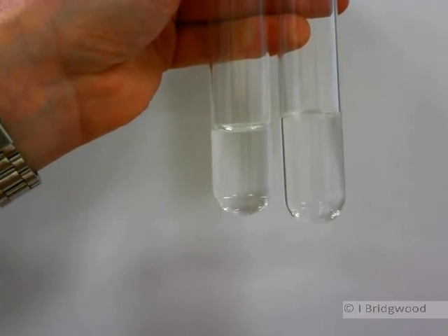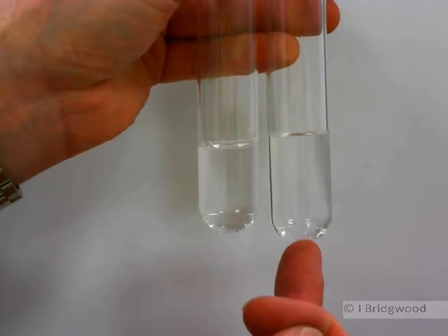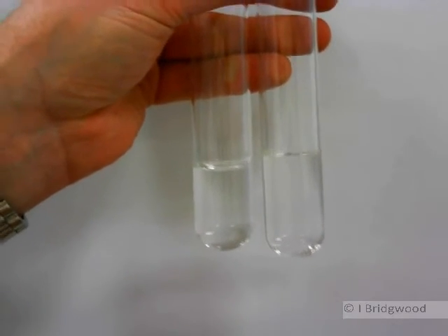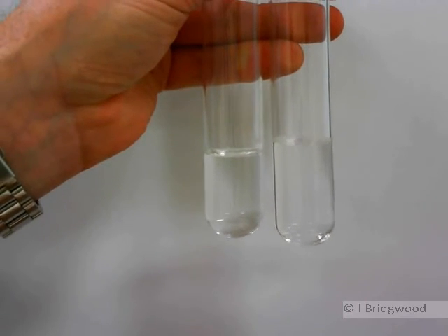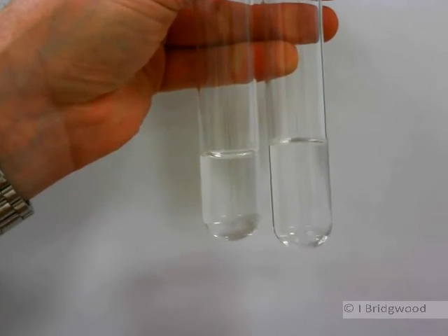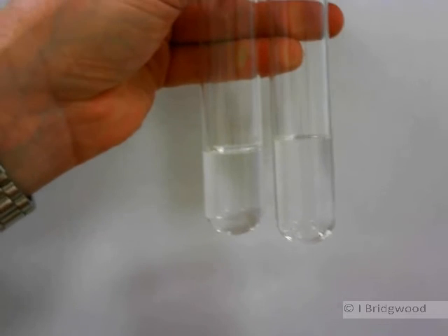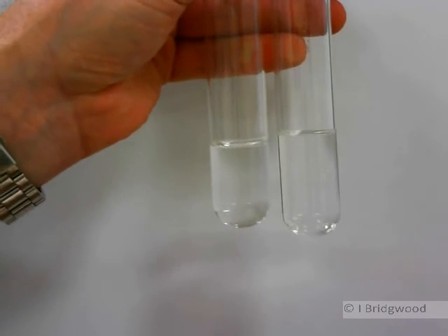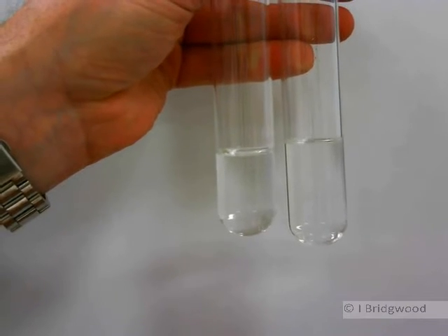Two colorless liquids, once again. You'll have to take my word for it. That is ethanol. That's water. Water, of course, has hydrogen bonding as its major intermolecular force. And ethanol also has hydrogen bonding between the OH groups. So that is its predominant intermolecular force.